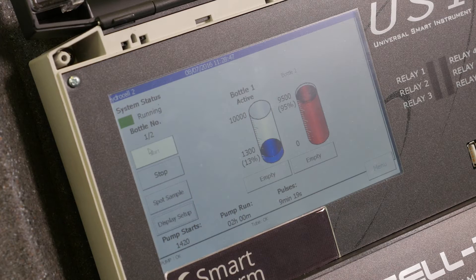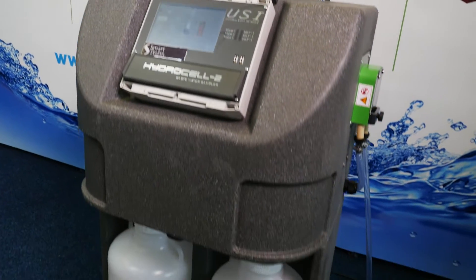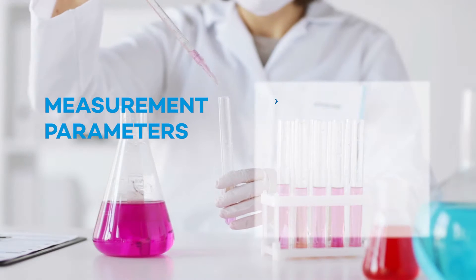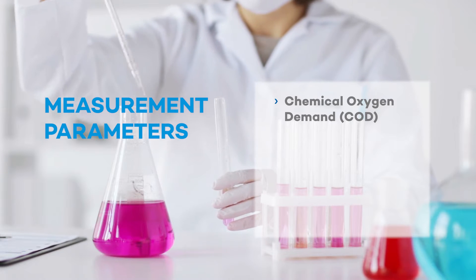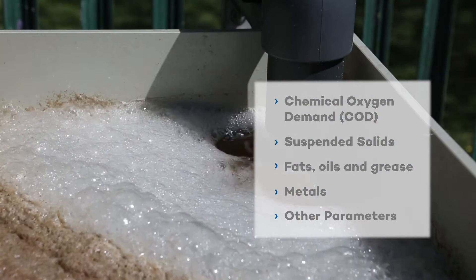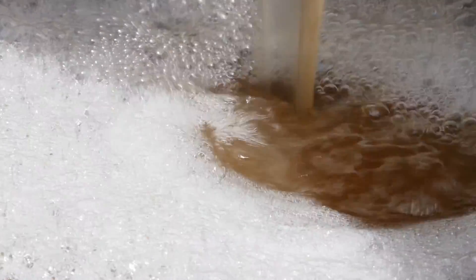You will also be asked to take wastewater samples using an auto sampler, which allows the water company to take away samples on a regular basis to measure how toxic your effluent is. From this they will measure other parameters specific to your effluent, including chemical oxygen demand (COD), suspended solids, fats, oils and grease, metals, and any other specific parameters which may contribute to a toxic load on the water company's treatment plant.